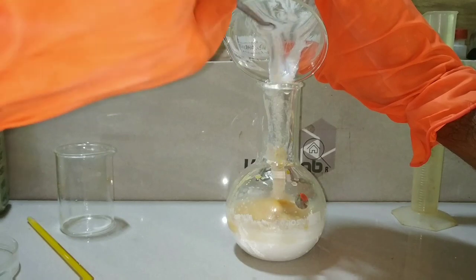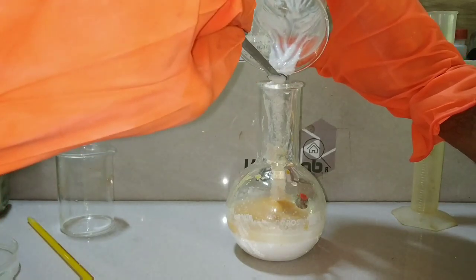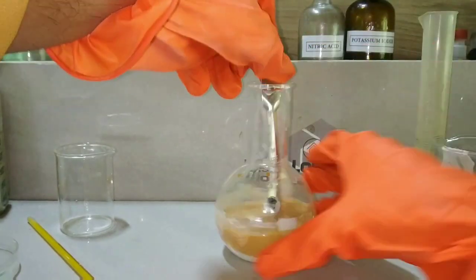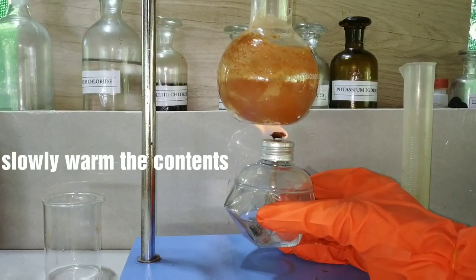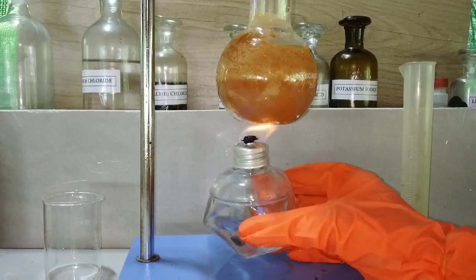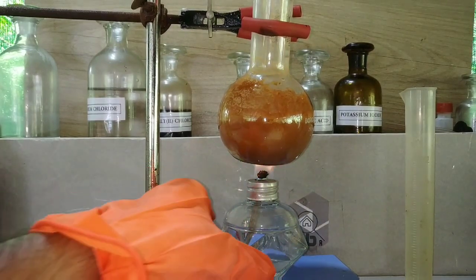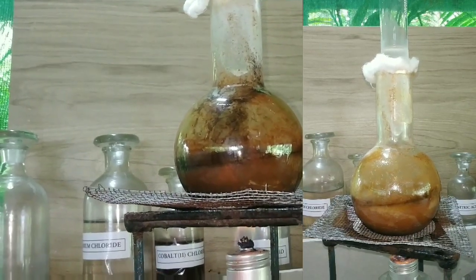As we know, lead 4 oxide has a dark brown to black color, but the color we obtained is not so black — that is because of the presence of other oxides of lead like Pb3O4 in it. Now we slowly warm the contents of the flask. We should not boil the solution quickly as the lead hydroxide will get decomposed. By giving a slow warmth, all the reactants will take part in the chemical reaction without decomposing. After all the hydroxides have reacted, we boil the contents for about 30 minutes.